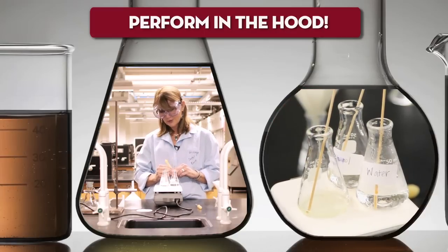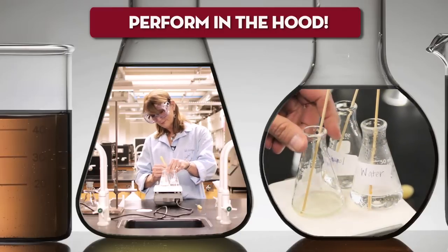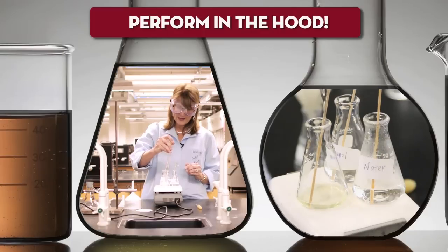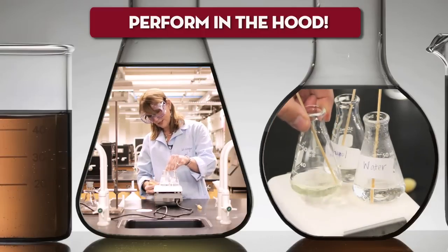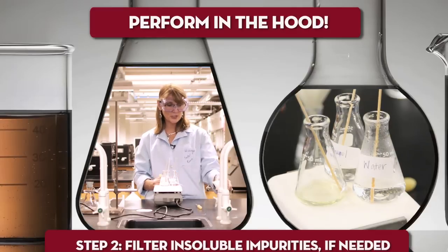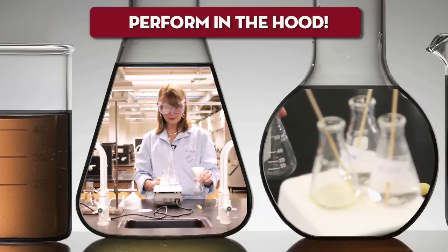You want to work slowly and not add too much solvent, because then your crystals won't come out of solution. Heat as you're dissolving. If you've added the appropriate amount of solvent and there are still insoluble impurities, you may want to do a gravity filtration to remove those insoluble impurities.